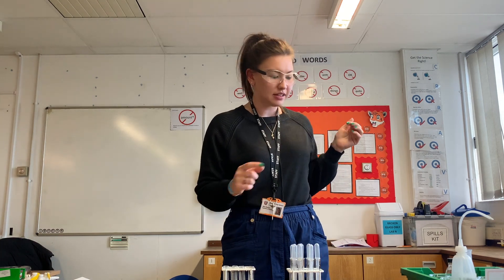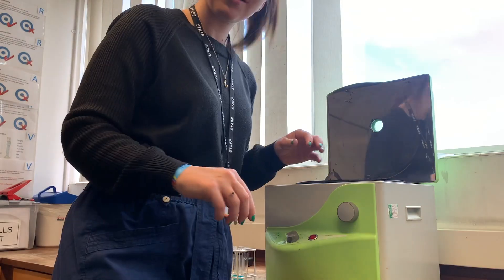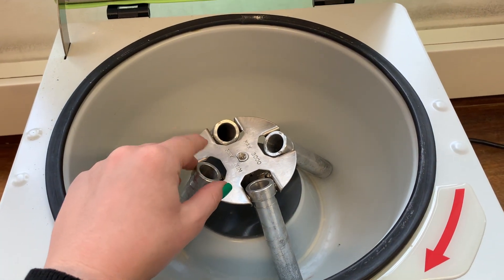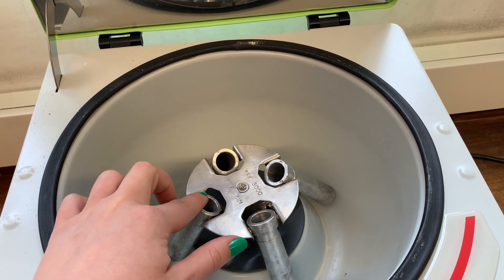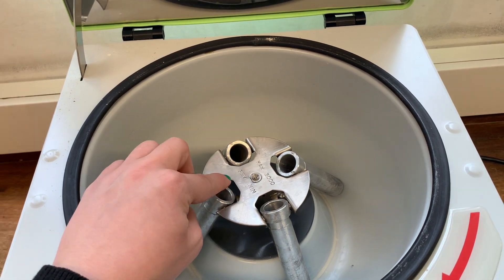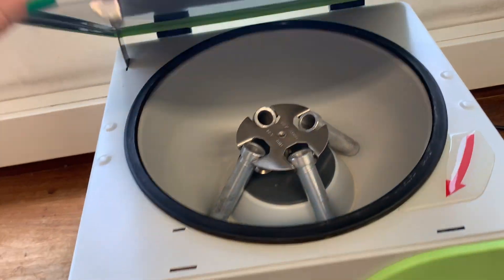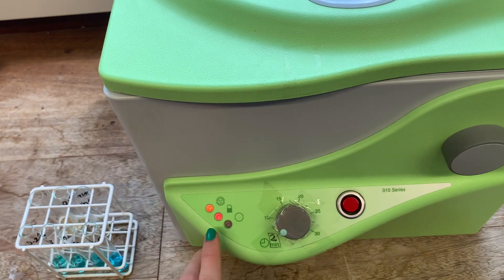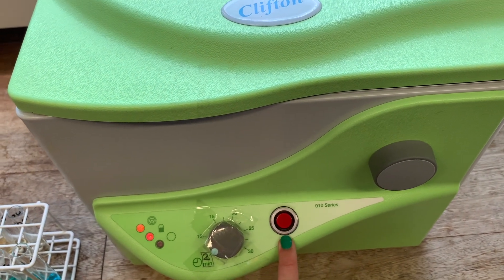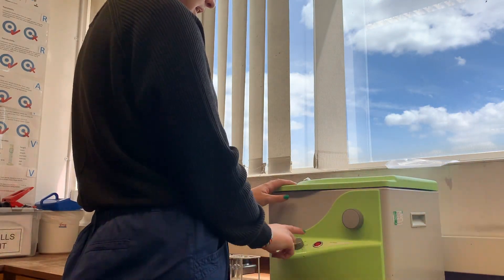With two centimeters cubed of each concentration transferred into the centrifuge tubes, I'll pop them into the centrifuge. You have to be very careful to balance the centrifuge: either have all four tubes in with the same volume of solution in each, or have two in on opposite sides with the same volume. When I shut it, a little light will confirm it's locked. The timer is set to two minutes - press the button to start. Locked, timer set, and start.